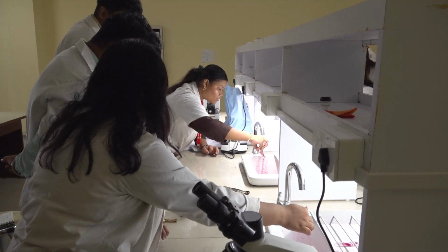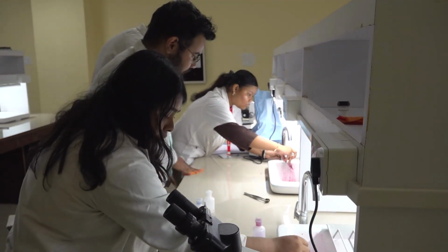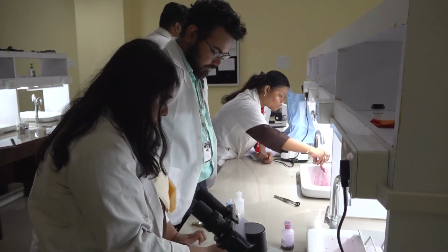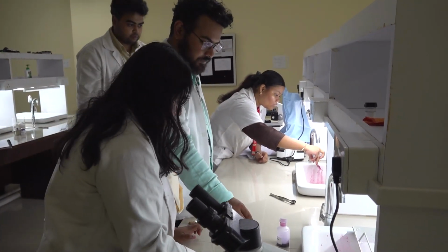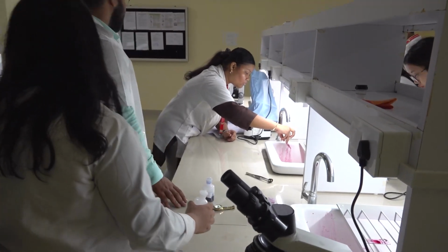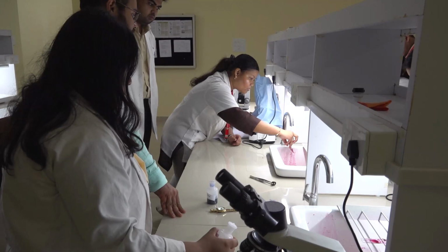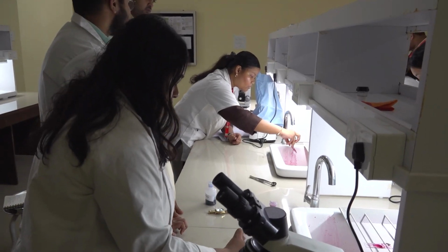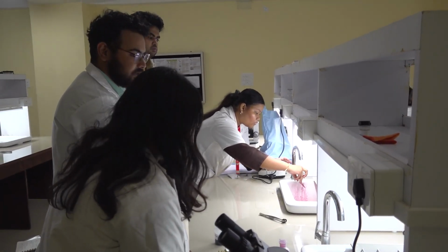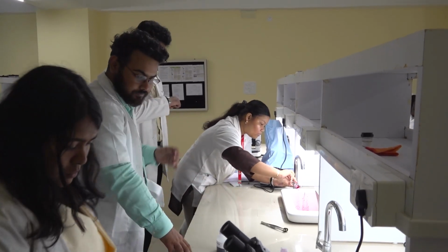Is it rinse, madam? छोड़ दो ये कुछ. Next step is decolorizer. Please pour the decolorizer. And for how many minutes you will keep it? Decolorizer कितने minutes? 2 to 4 minutes. Here we will take 4 minutes, okay? Because it's a weaker acid, dilution factor थोड़ा कम है, ठीक? इसलिए we'll keep it for 4 minutes, okay? Please go ahead.